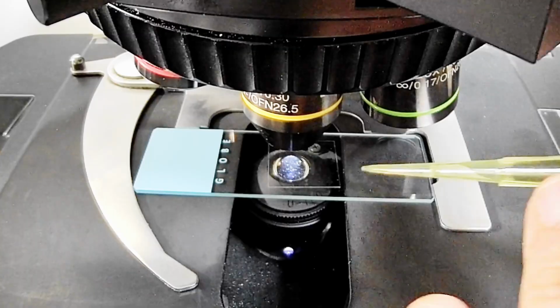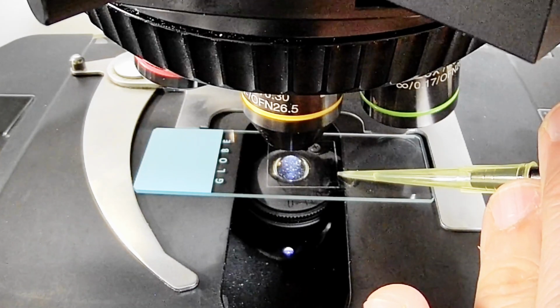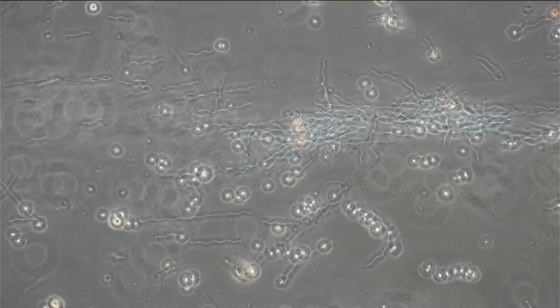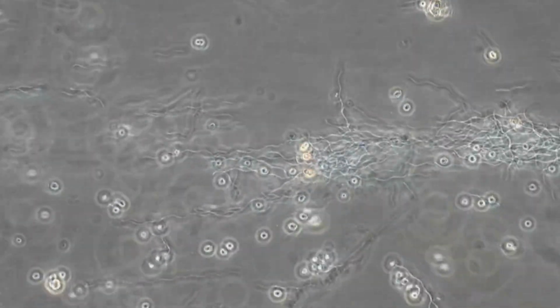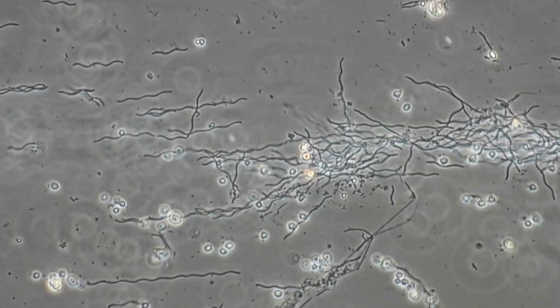Okay, so what I've done is I've taken a small sample, a small drop of this hand disinfectant, and I added it to the edge of the cover glass, and then capillary action has drawn in the disinfectant beneath the cover glass, and it got mixed in with the bacteria. And when we do that, we immediately see that many of the bacteria are swept away by the stream of the liquid, and this of course makes it quite difficult to observe. However, I could also see that some of the bacteria actually stayed connected to the glass surface. Evidently the distance between the cover glass and the slide was quite narrow, so many of them, or some of them at least, got sandwiched between those and could not move away.